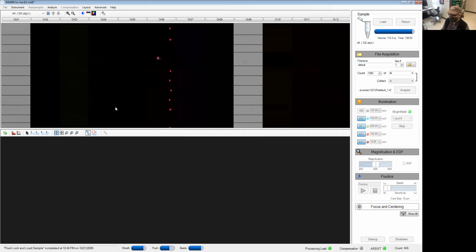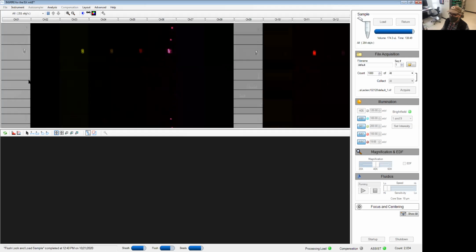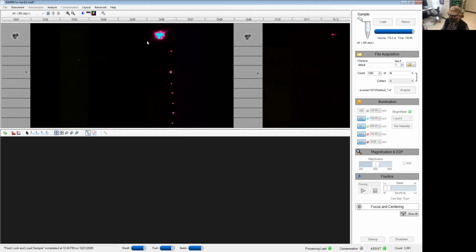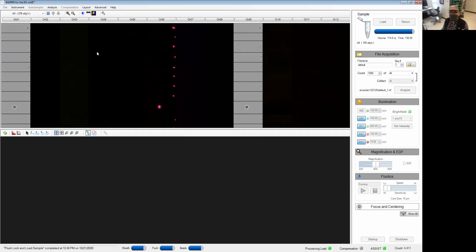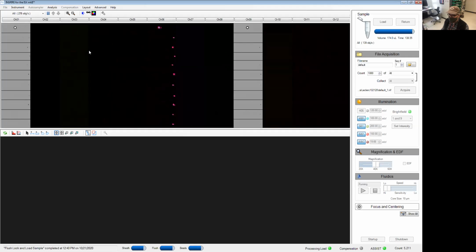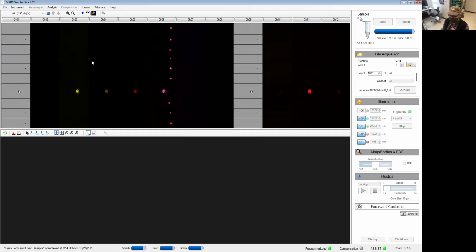So the top window shows me each event that is crossing the laser beam. We see some of them are the speed beads, some of them are the actual beads I'm interested in. We're looking at the mix of single stain PE and APC beads plus the negative control. With this window, there's a couple of things I can show you.